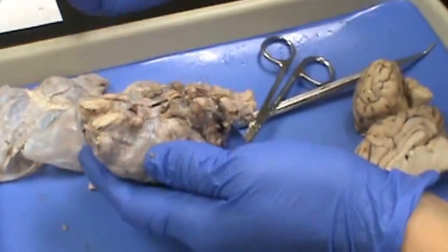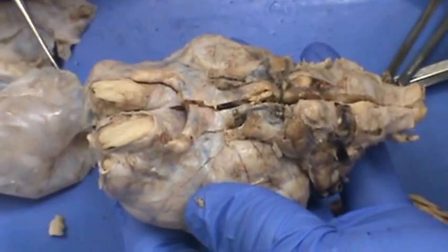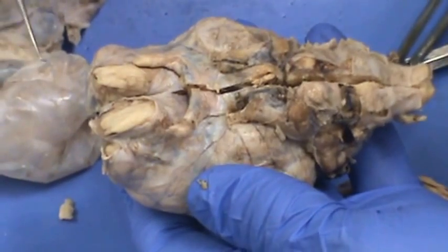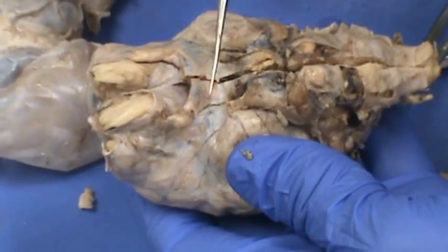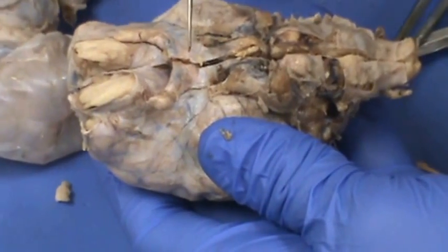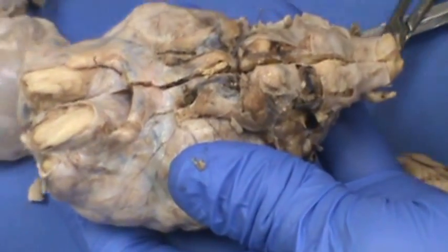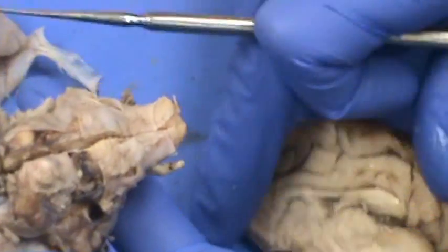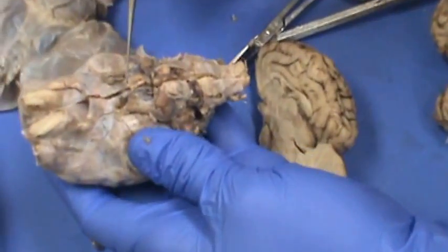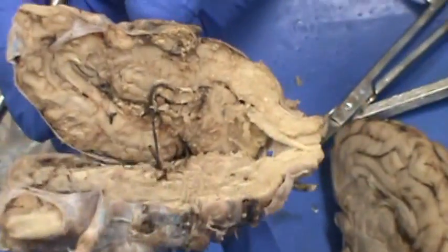Let's look at the underside of the brain and identify structures. These right here are your olfactory bulbs, which are going to be in connection with your olfactory nerves for smell. These two structures here are the optic nerves, and where they cross is the optic chiasma. The back part of the X are called the optic tracts. This is the pituitary gland here.